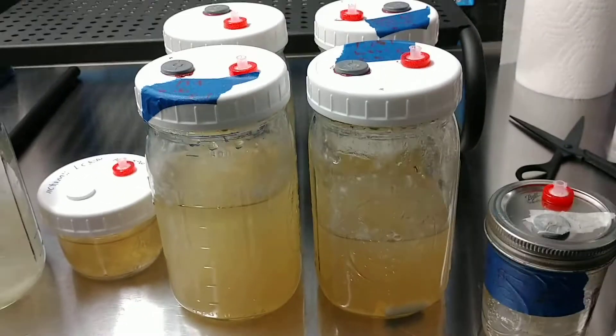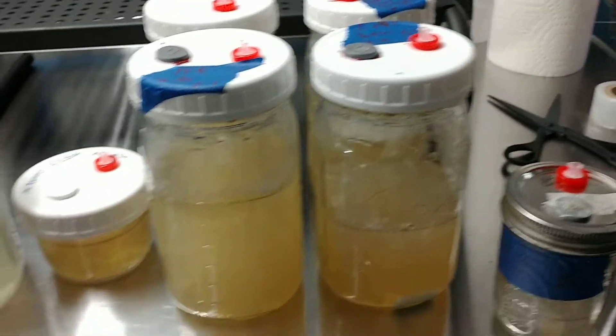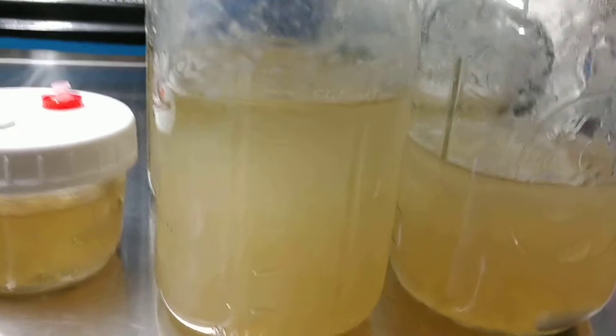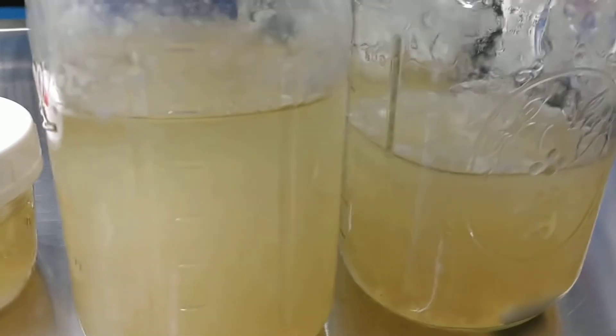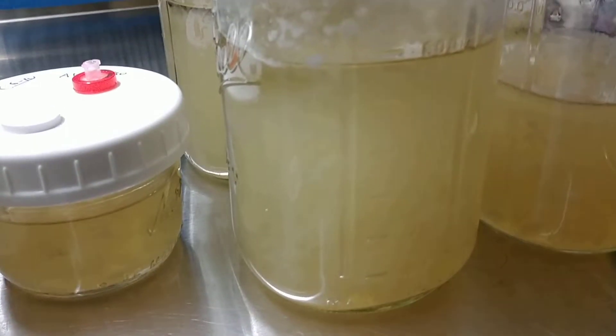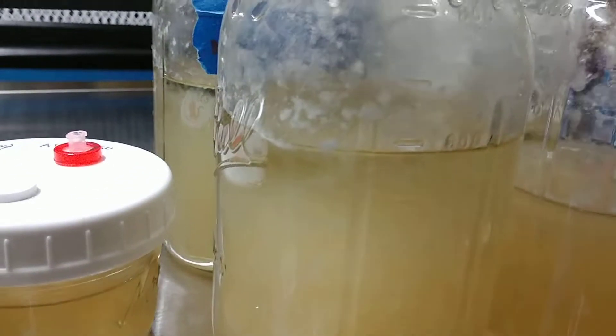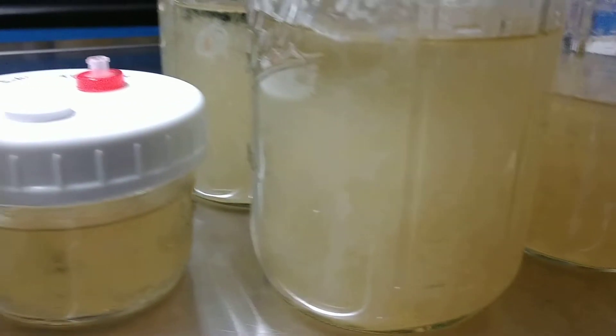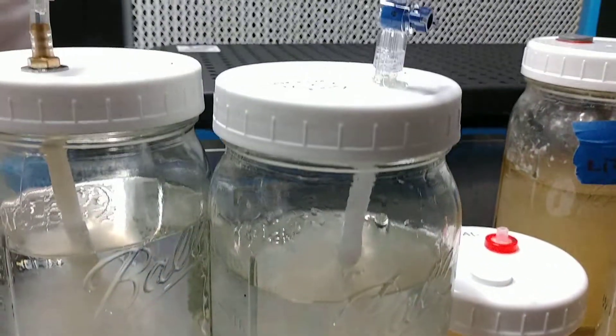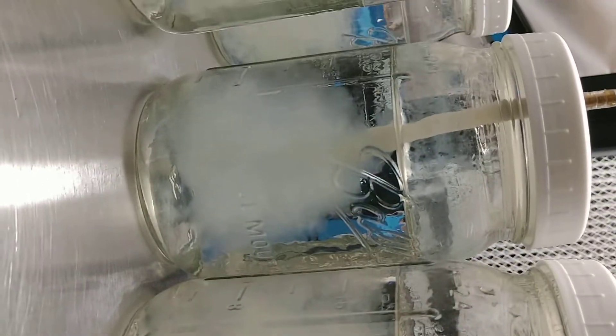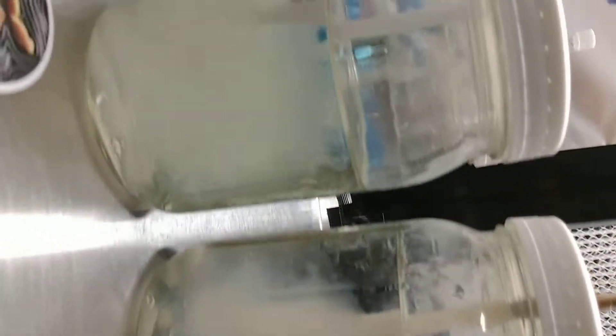Okay, this is culture and it works, it's good, but there's something you can do with it. Proof it on agar, grow a few bags, and if it's good you put it in sterile water and make a suspension, a mycelium suspension.